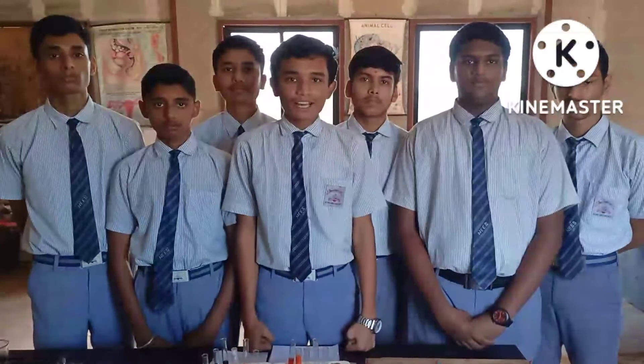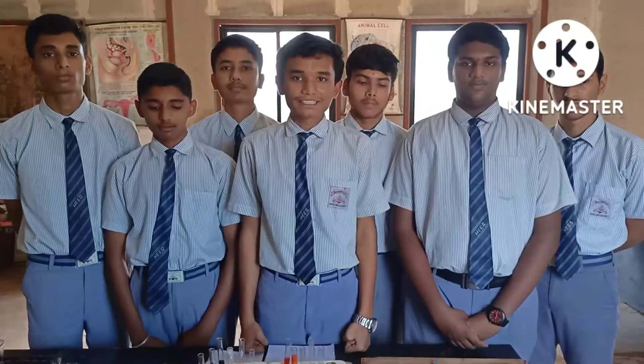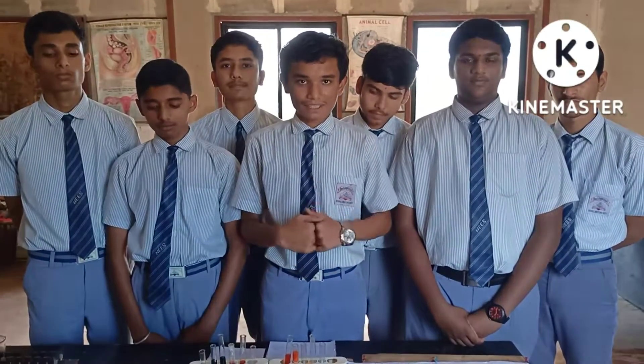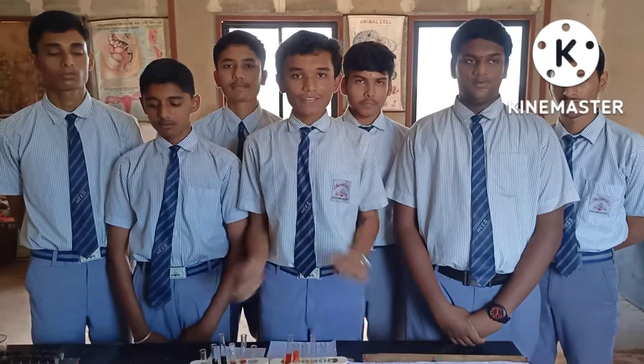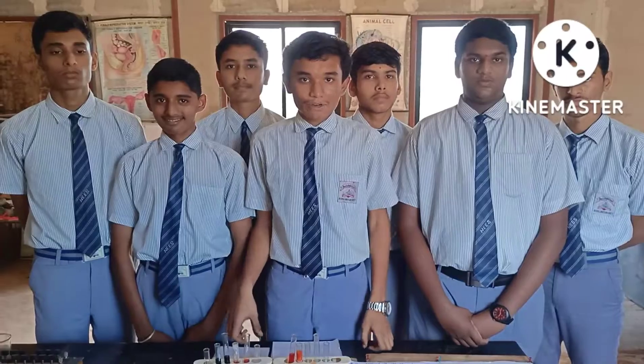Good afternoon. We are the students of Nivira English School, grade 10th, and our group name is Albert Einstein. Today we are going to perform an activity.